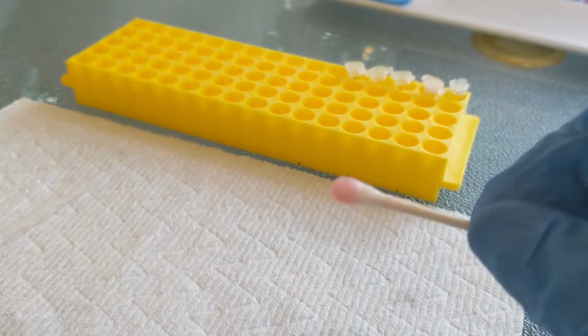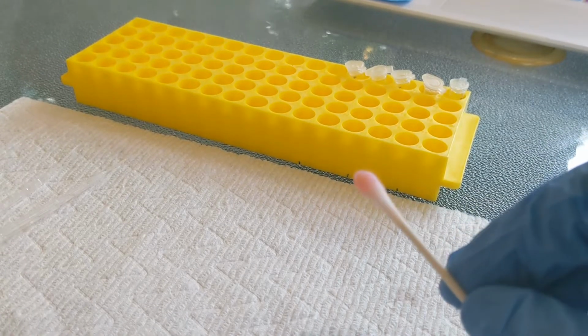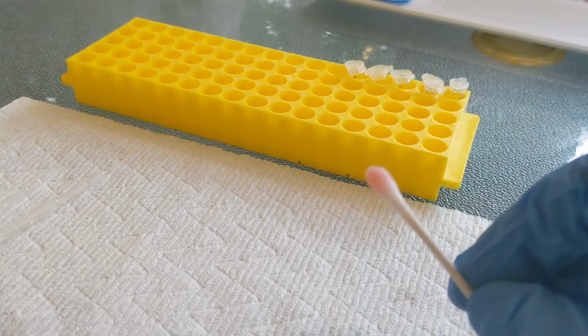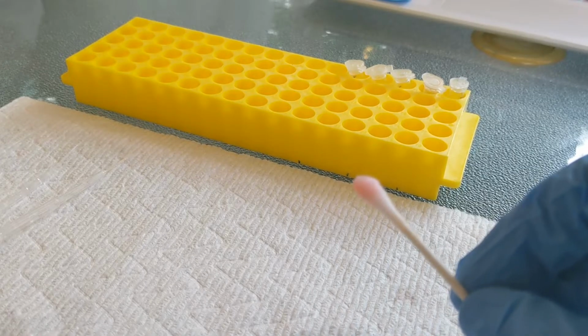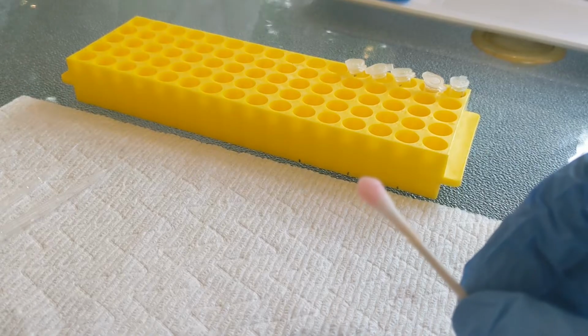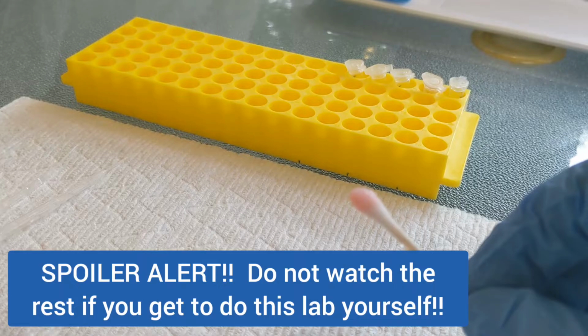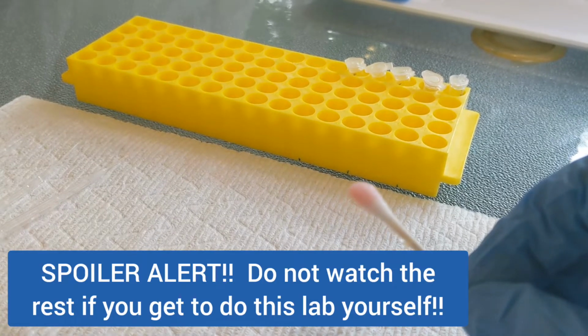So if you are going to run this lab yourselves, you can now get your supplies, stop the video, and go ahead and run the lab. But if you are learning from home or for some other reason can't do the lab, Lily and Taylor and Rowan and Anna are now going to demonstrate the other 4 samples. They're going to process the other 4 samples.